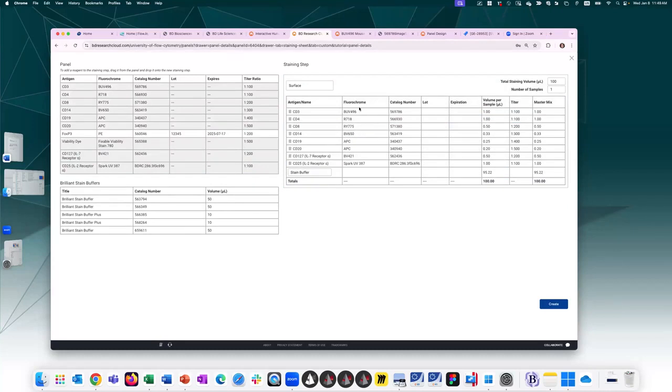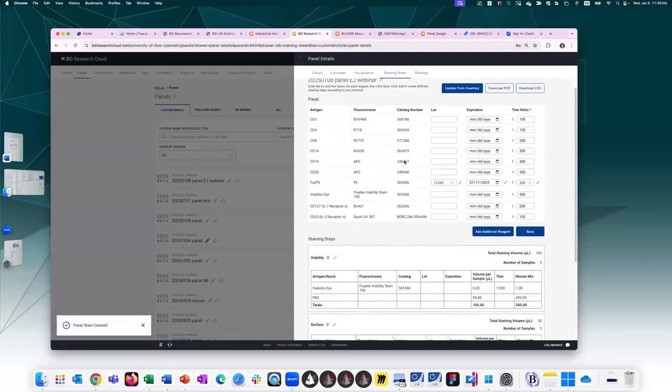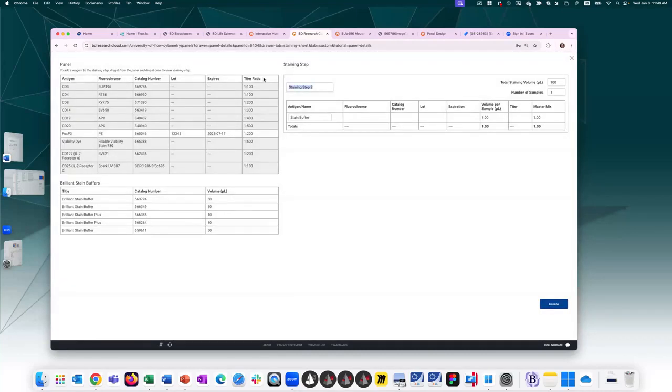CD25 is surface. If I'm using any brilliant UVs or any brilliant fluorochromes, I will want to include a brilliant stain buffer. So I can drag any one of these with the recommended staining volume for that sample. Again, I can change the staining volume to whatever I want and number of samples 5, and it will update the math for me based on the titration information I have provided. So let's go ahead and create the second stain step. So I have a viability staining step, surface staining step, and I'm going to add one more, which is going to be the intranuclear.